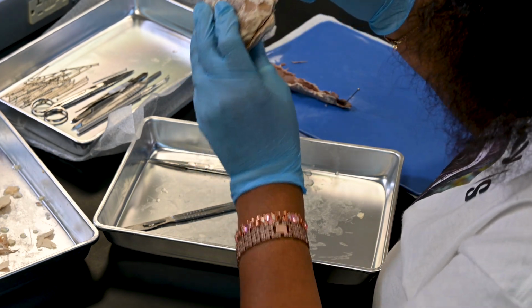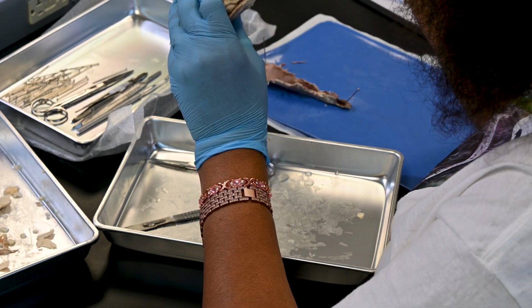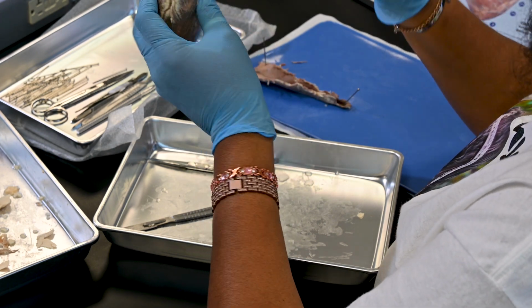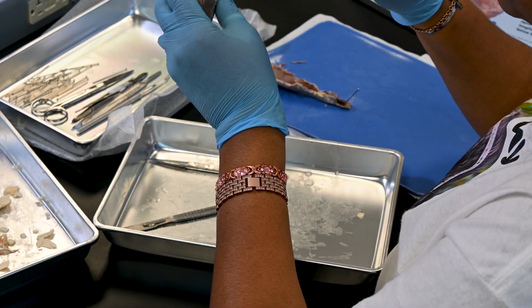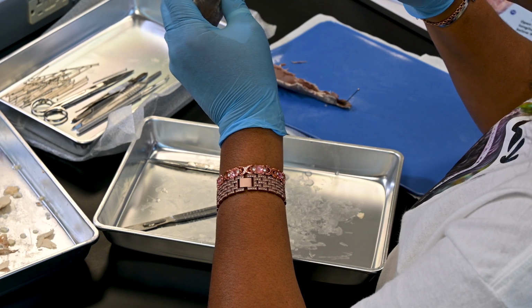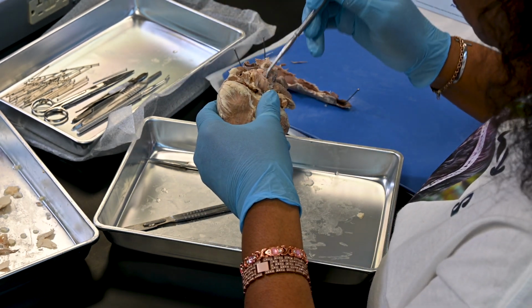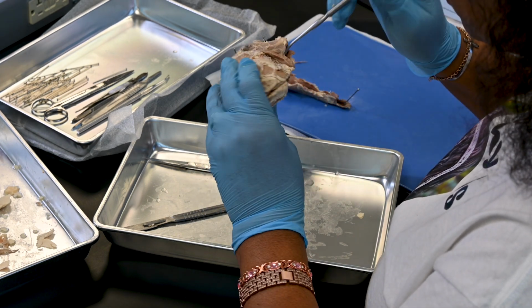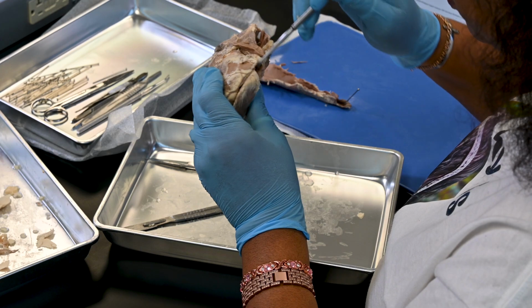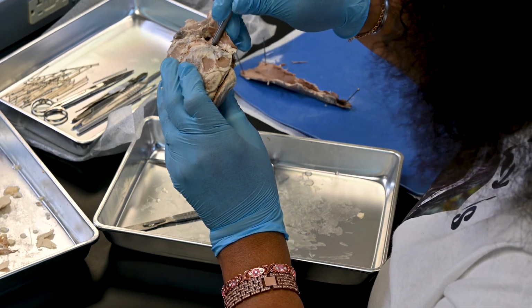We got one right there, and that would have been right there. And 17 right there. That one is thin, very thin. Got that one right there. It's covered. And then the one here. And then that one back here.